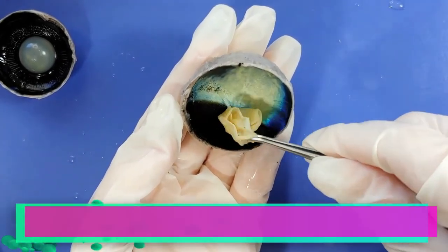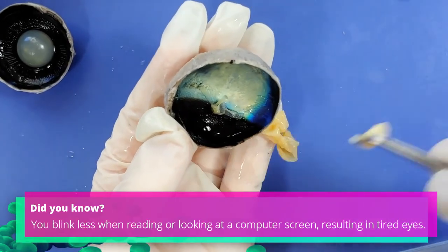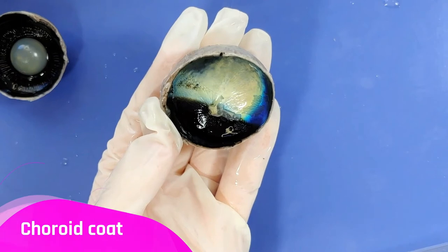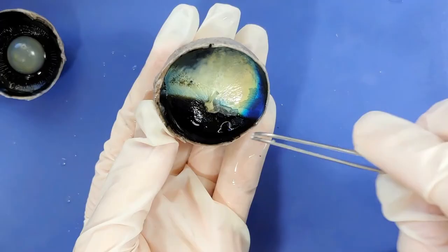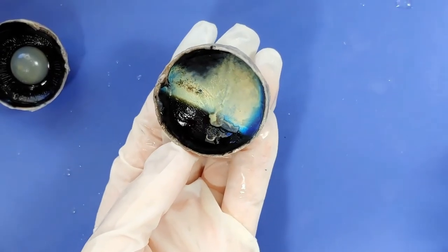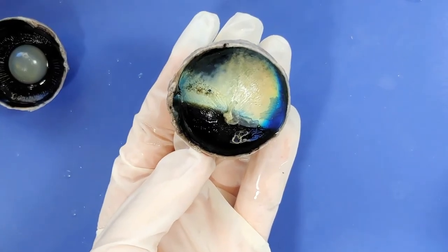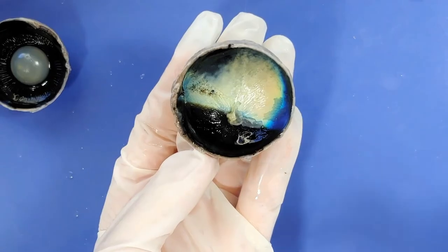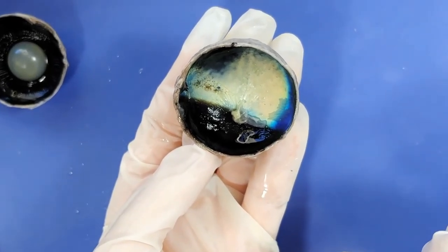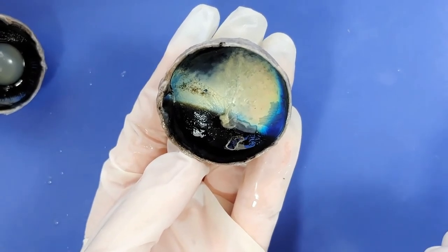Now I'm going to remove the retina. Beneath the retina is this black layer called the choroid coat. It has a lot of blood vessels in it, and it serves to provide the retina with nutrients. You can also see that it's iridescent in places — it's very pretty and it's kind of blue. This is called the tapetum lucidum, and unfortunately humans don't have this. However, certain animals like cows do have it, and it's to enhance night vision. This reflective surface allows light that passes through the retina to be reflected back, giving a second chance for that light to pass through the retina again. In animals that have this, when you shine a light in their eyes, their tapetum lucidum reflects it back, and that's why you can see their eyes glow.